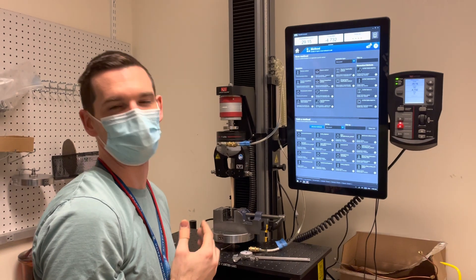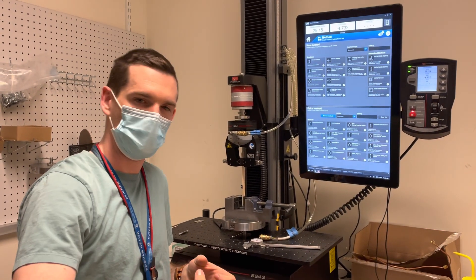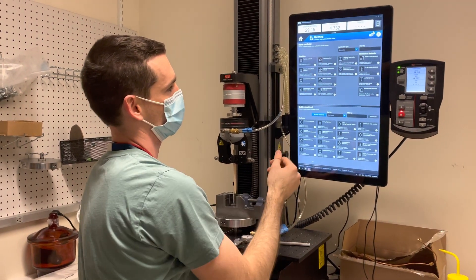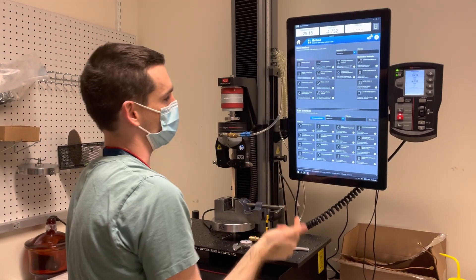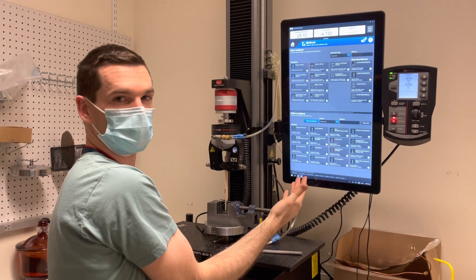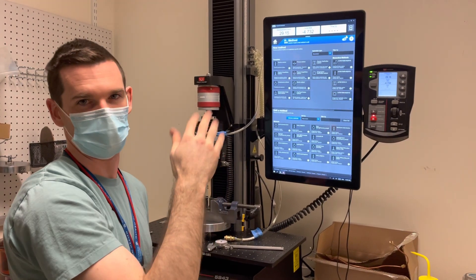If you were to set up a new one, you consider: am I doing a tensile test, am I compressing something, am I bending something — and you would choose that from one of these options on the top. I've already made one and saved it, and those would show up down here. These are the most recent ones. If you made one a long time ago, you can just browse and find it in a folder.